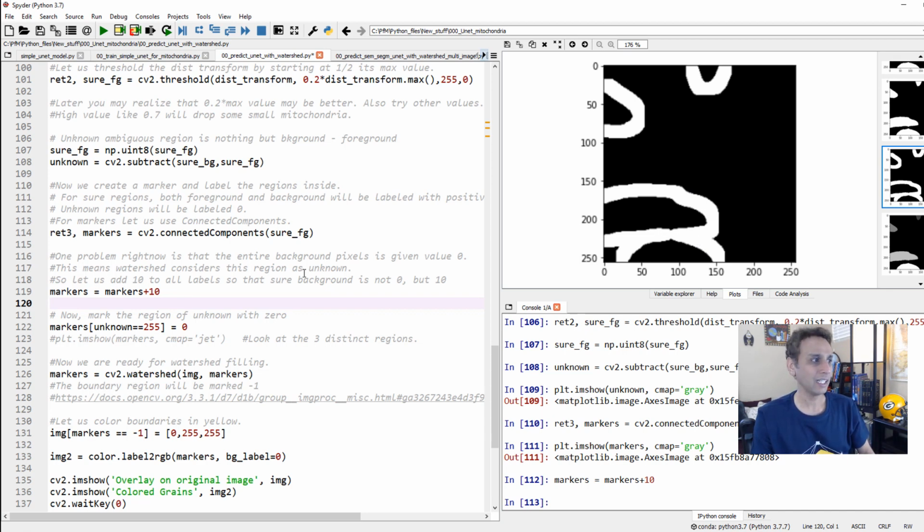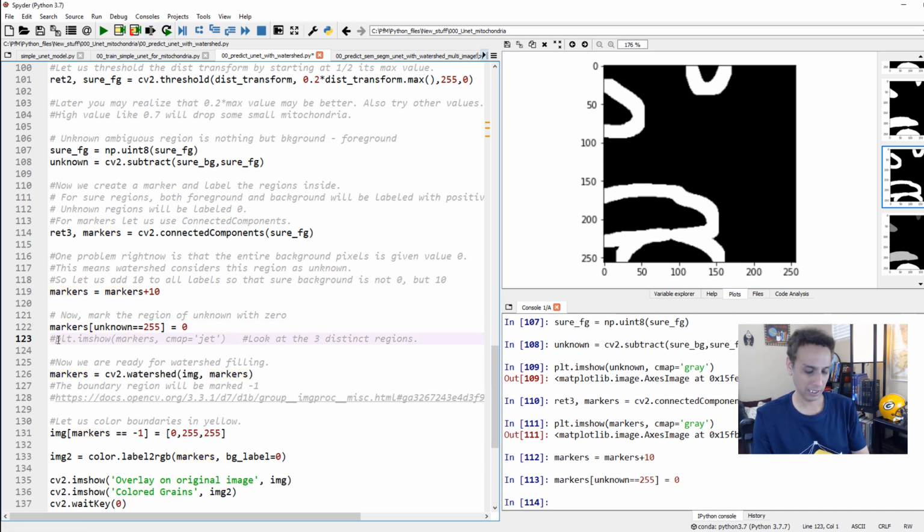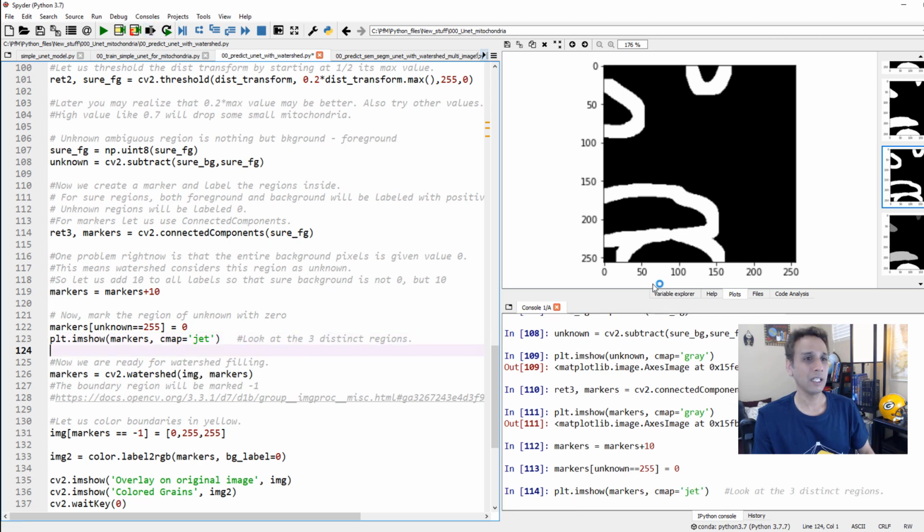Okay, so for that, how do we do it? Markers wherever my unknown equals 255, right? Remember our unknown, this is our unknown image. So background is 0, this is 255. So all we are trying to do is wherever my unknown is 255, go to my markers and change the value to 0. Okay, so let's go ahead and do this. And if I plot it, you'll see what we mean.